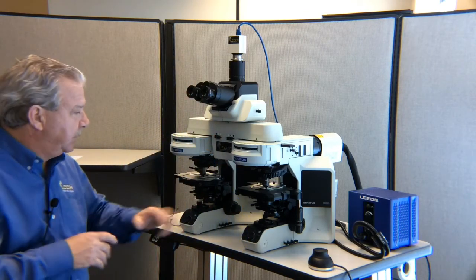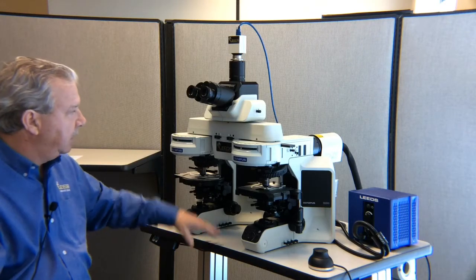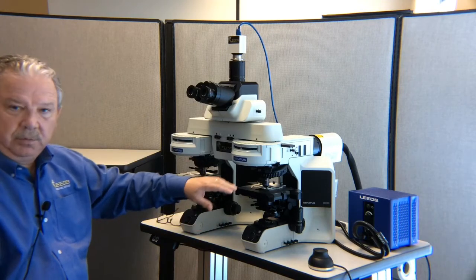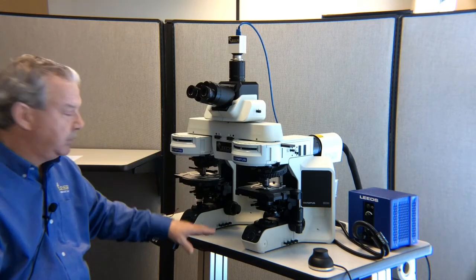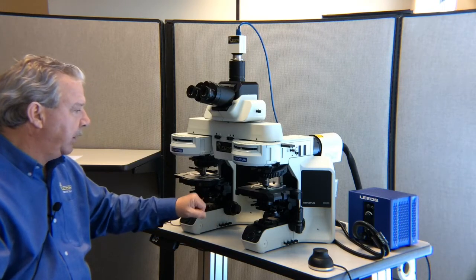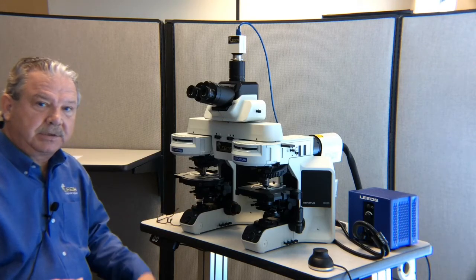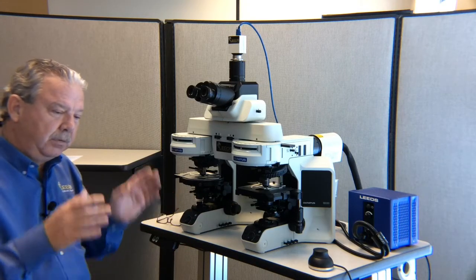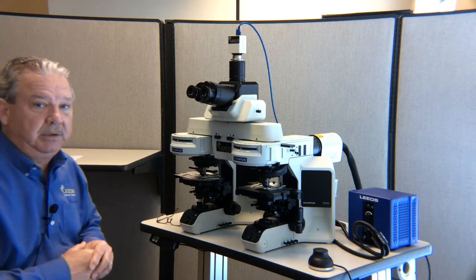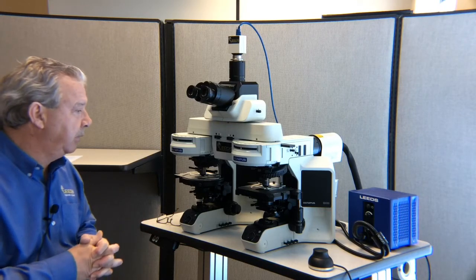Now, you say, what about all those other accessories? I want to be able to use those. We've gotten the microscope set up to its proper setting, and now you'll be able to bring in each of those individual filters or techniques that we don't currently have active on the microscope. As long as we bring the same accessories or filters in on the right side of the microscope as we do the left, then we should be able to maintain color balance while running through the various imaging techniques that we have.